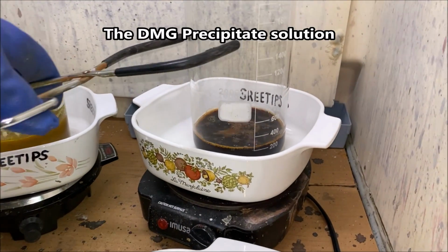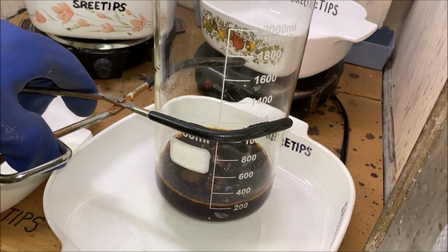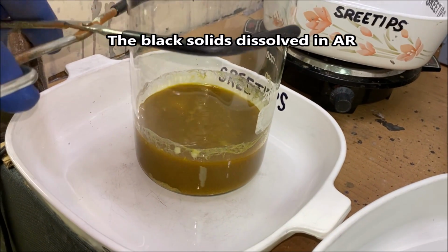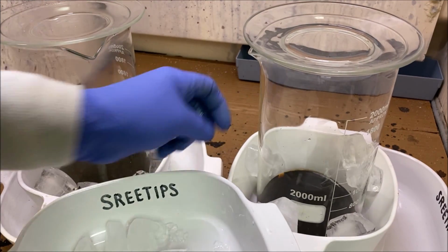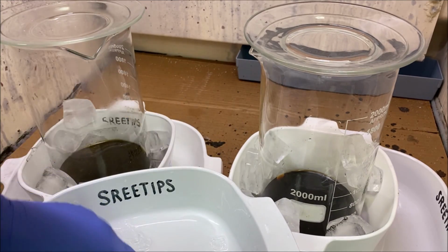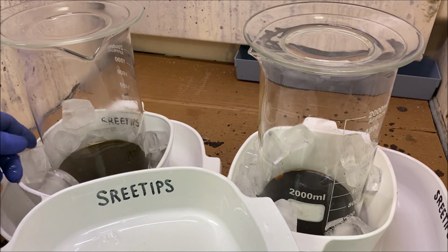Okay, I think what we'll do now, pull these down off the heat and let these things cool. I've allowed the solutions to cool down to room temperature, and now I'm adding some ice to try to chill it down even further. This should help us when we go to filter these solutions.